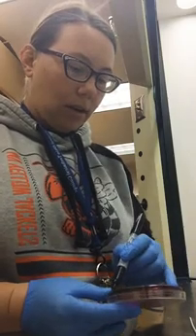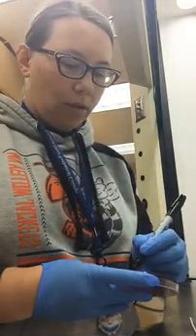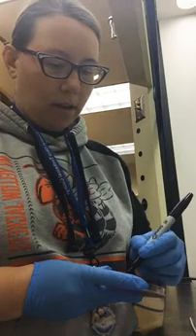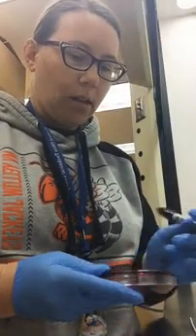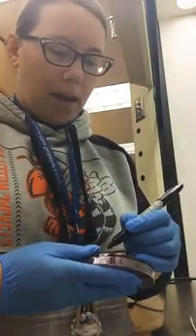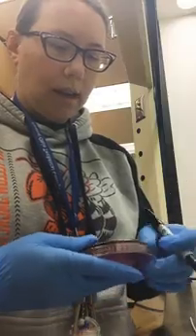So we like to do the trisection. We're going to do, let's see, Kocuria rhizophila, that's our gamma. And if you want, you can even label it with the expected type. There's my K. rhizo with my little gamma symbol. We're going to do B. cereus, which I think is our beta. Double checked. So B. cereus with a sort of funky looking capital B. It's my Greek letter, beta. And our alpha hemolysis will be performed by the S. epidermidis. And so I've got S. epi with a little Greek alpha, also looks like a little fishy symbol.